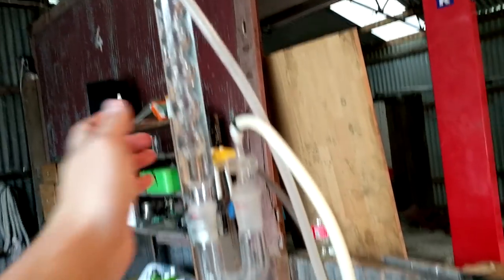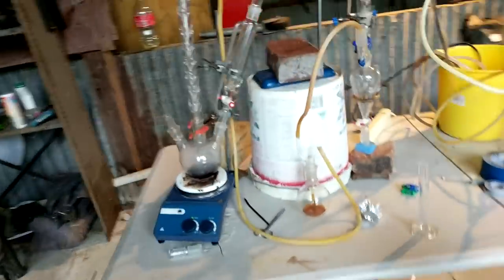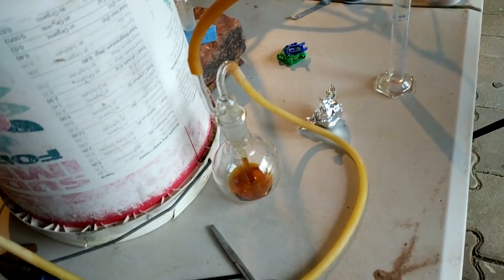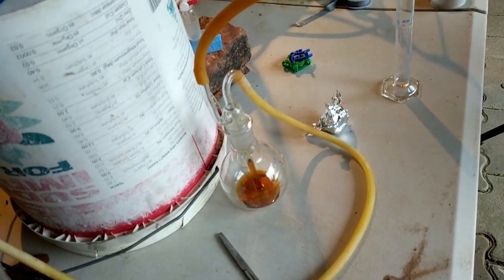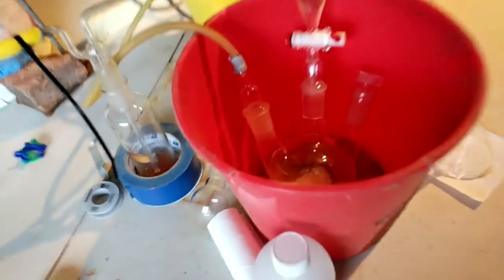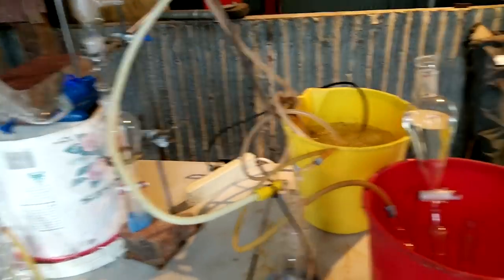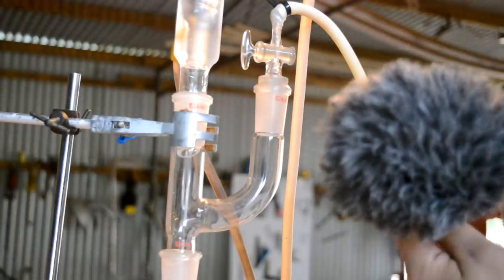We've got lots of ice in the water bath. The condenser is cold. Some isobutene coming through. There's a lot of suck back, but I can just keep fighting that. It's not too much of an issue. We've got the TCCA going, the hydrochloric acid. Let's just start putting some chlorine in and see if we get anything at all happening.